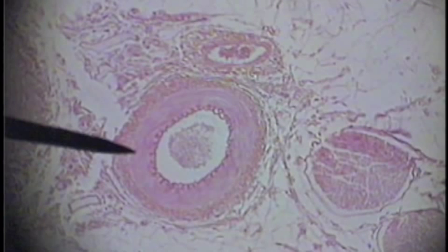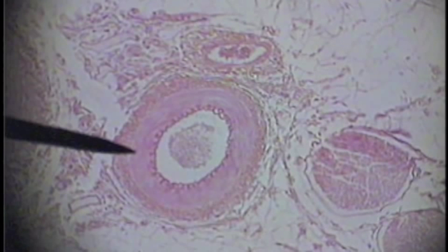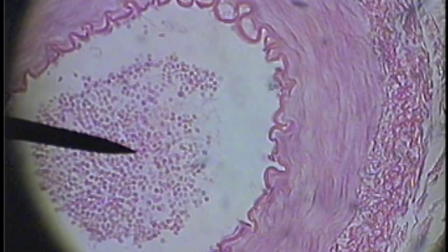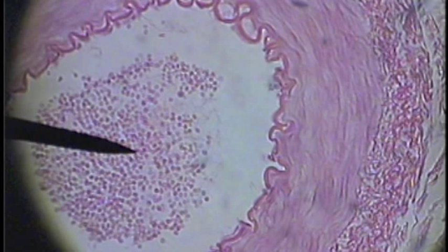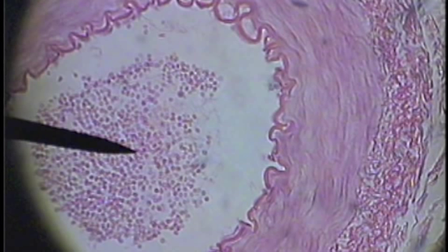On this slide we see both an artery and a vein. We'll go to a higher power to determine which is which. Here we see an artery, and I know it's an artery — it will be more obvious to you on a higher power. Here we see a cut through an artery. The pointer is in the blood found in the lumen of the artery.